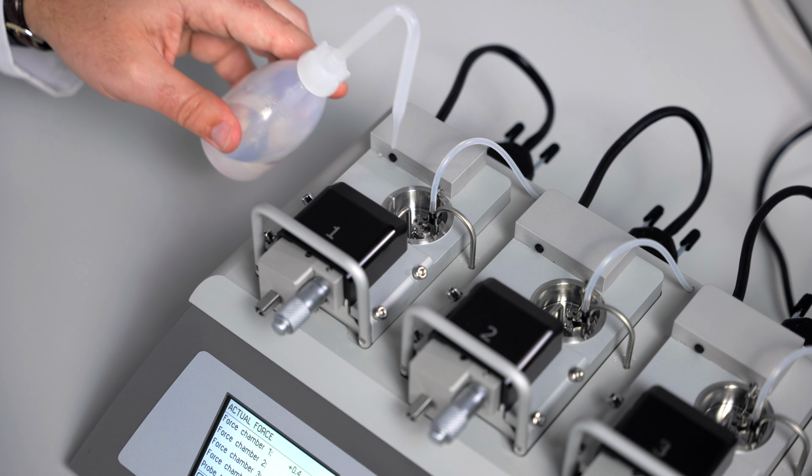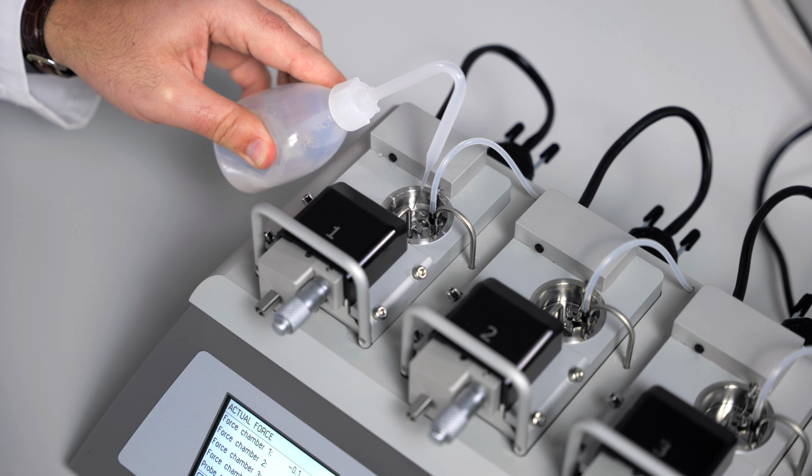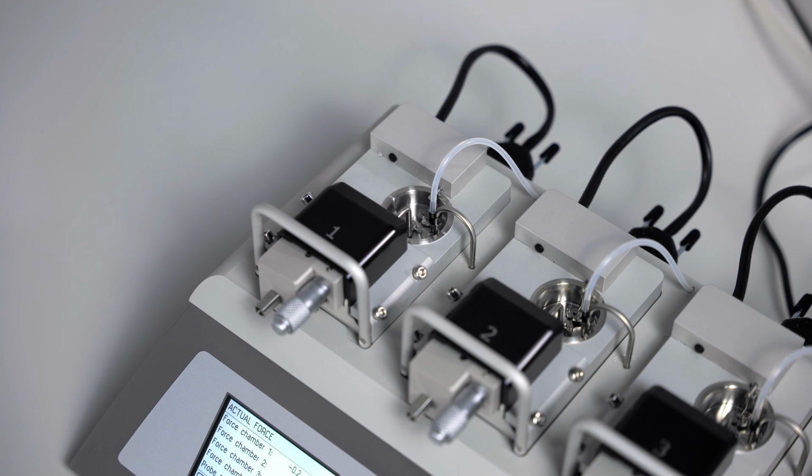If either of the above has been used, make sure you do a thorough wash of the chamber and the mounts with double distilled water. No ethanol or hydrochloric acid should remain, otherwise corrosion will result in the chamber. You want to perform these deeper cleaning protocols as little as possible.